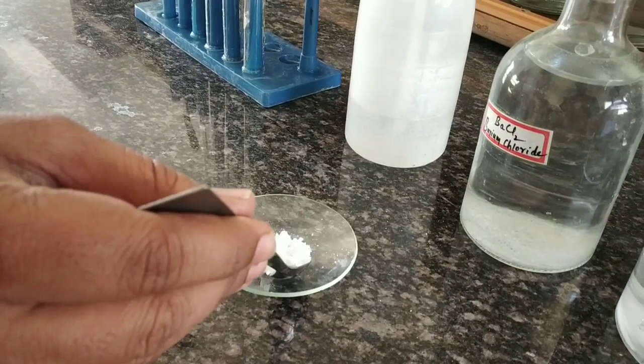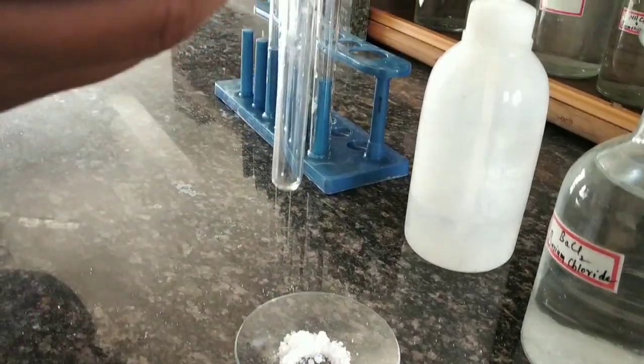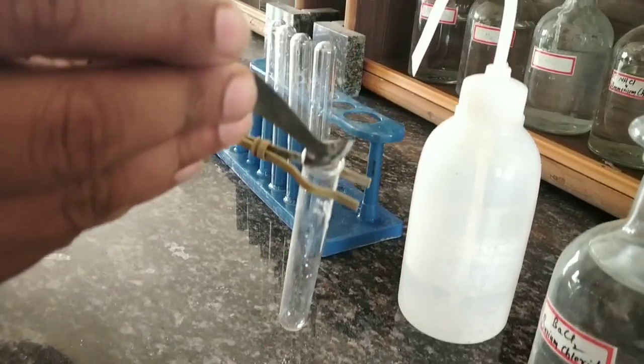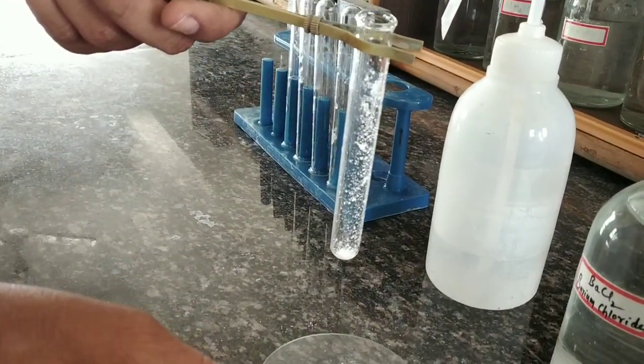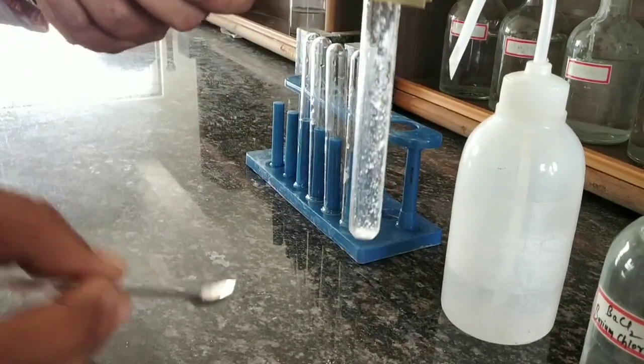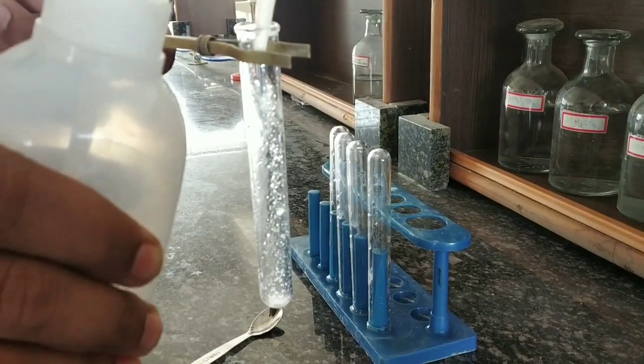Take this crystalline salt into a clean test tube and make it a salt solution by the addition of water. Take just one milliliter of water.